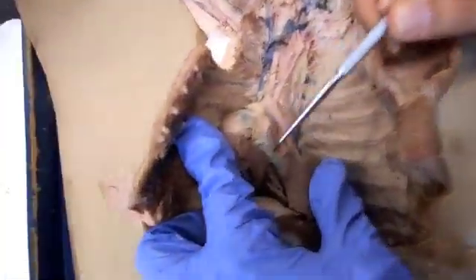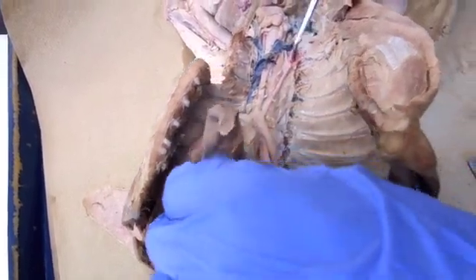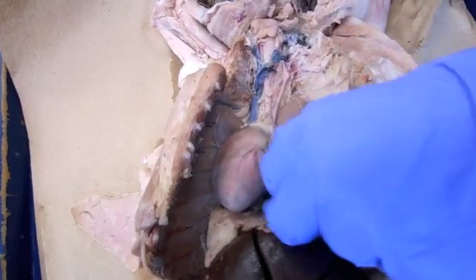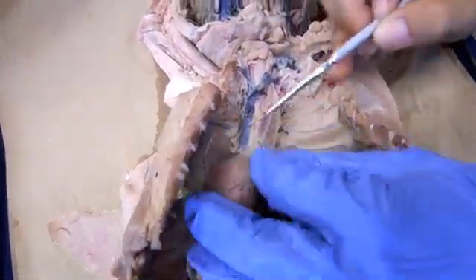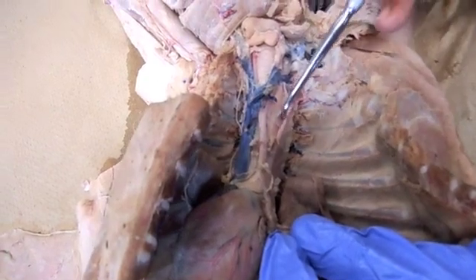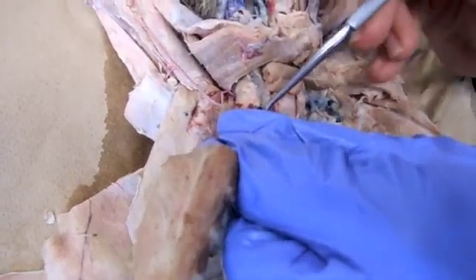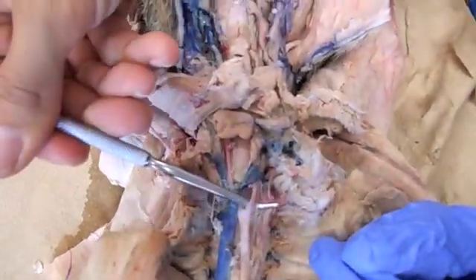You have the pulmonary artery and pulmonary vein — remember on the right side they're switched: the artery is blue and the vein is red. Then you have your arch of aorta right here, your brachiocephalic, your left subclavian, your right subclavian, your right common carotid, and your left common carotid.